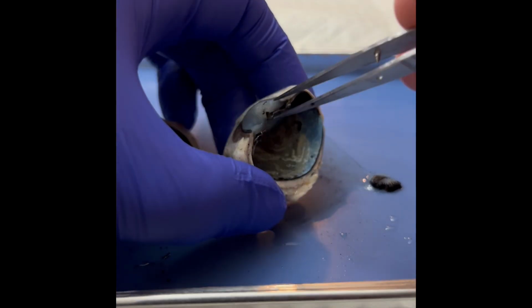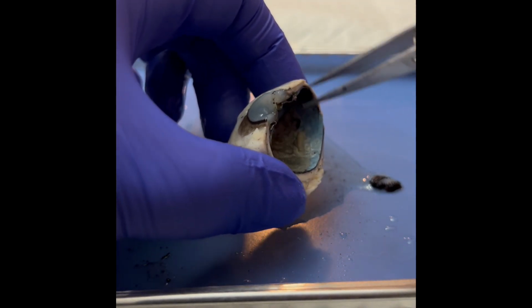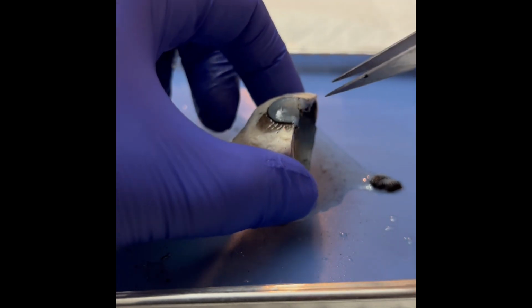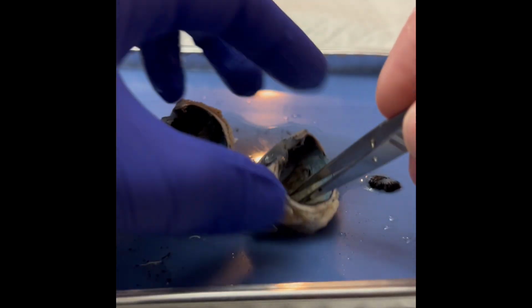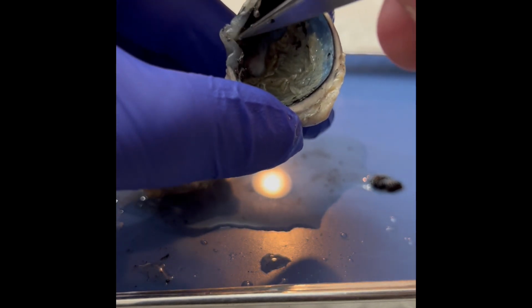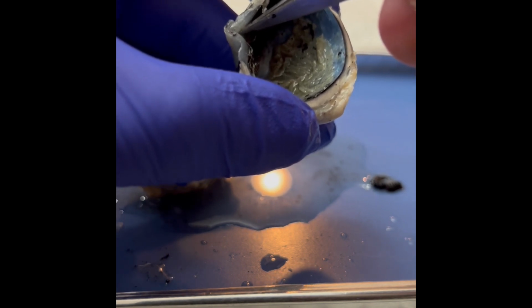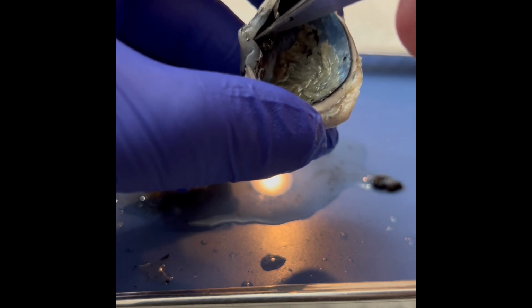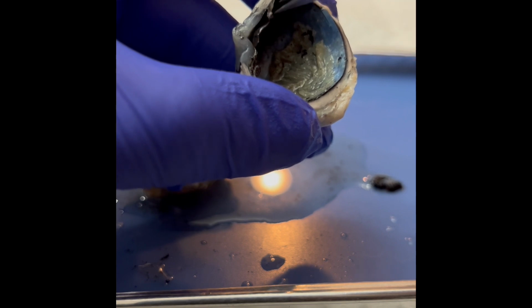The cornea is going to be this semi-opaque membrane right here. And then the sclera is all this white tissue right here. Next, we're going to have the anterior chamber. If you look here, you can see the sclera, the iris and the cornea. This little gap, this little space where my tweezers are right now, that's going to be the anterior chamber, the space in between the cornea and the iris.